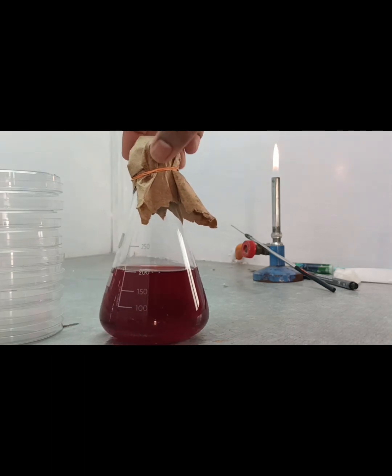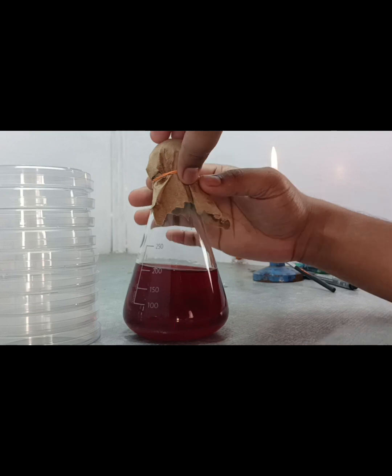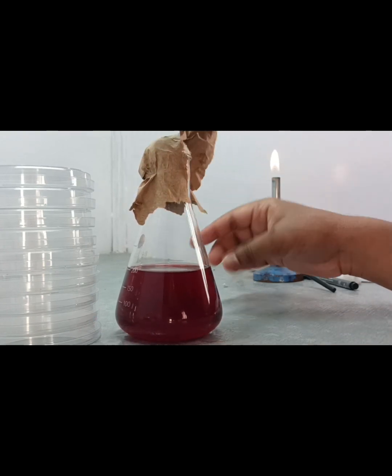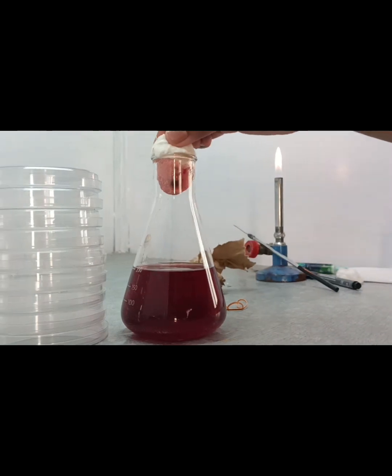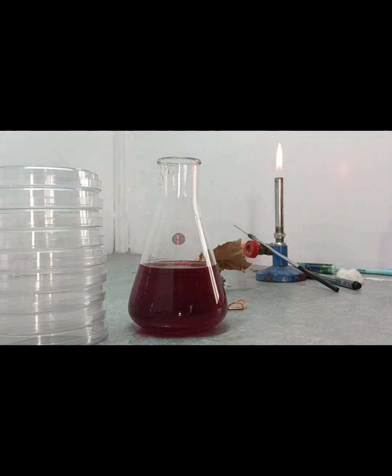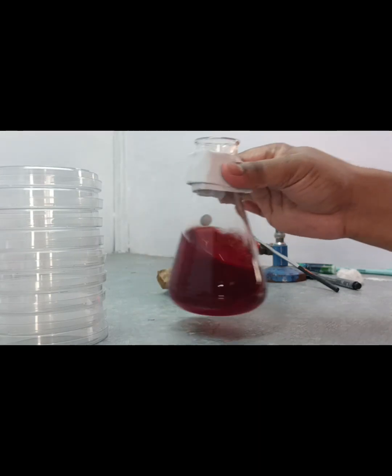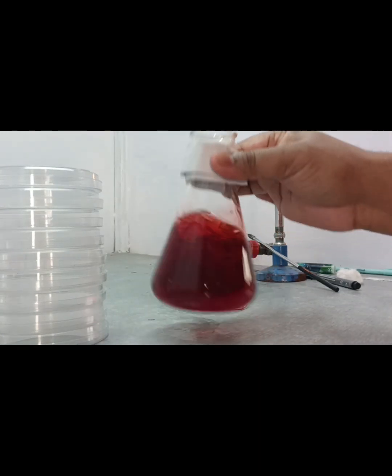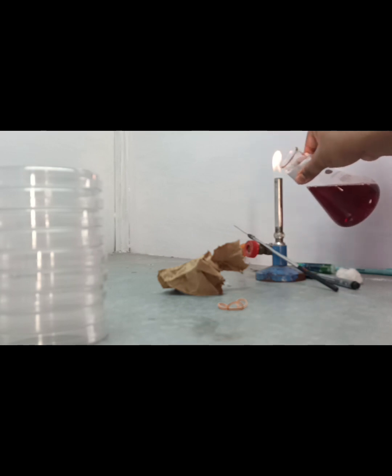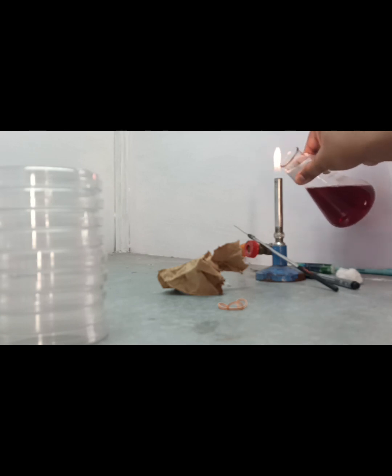After that, we have to pour the agar into the plate. Before the procedure, we have to remove the paper from the mouth of the conical flask and remove the cotton as well. After that, we mix it properly like this, and clean the mouth portion of the conical flask.